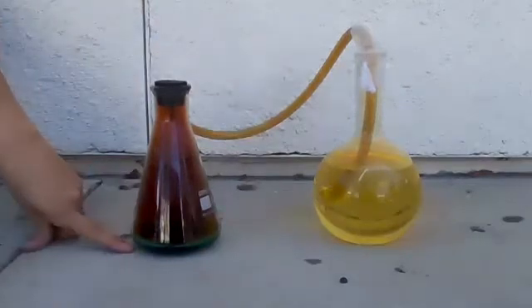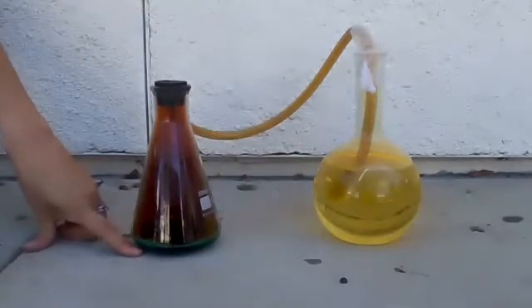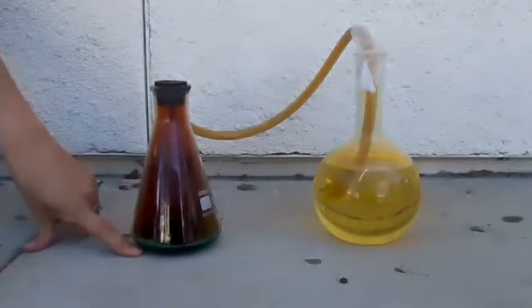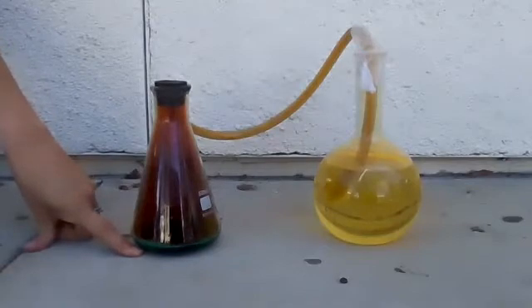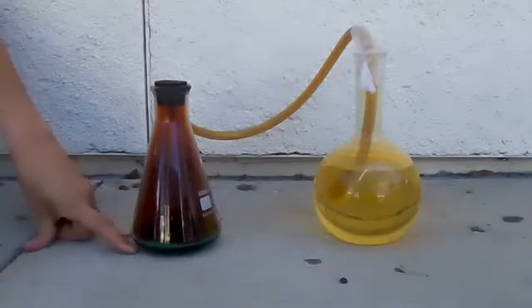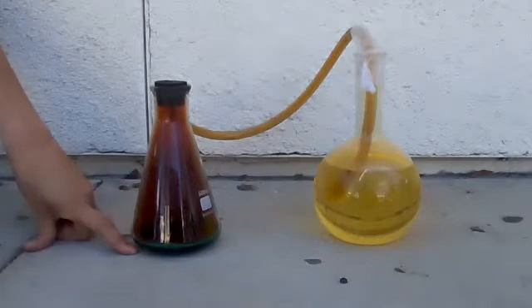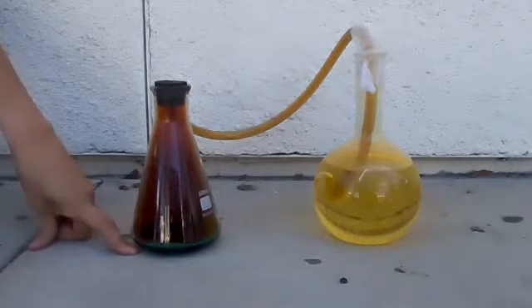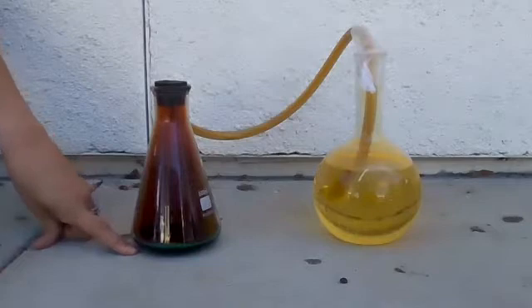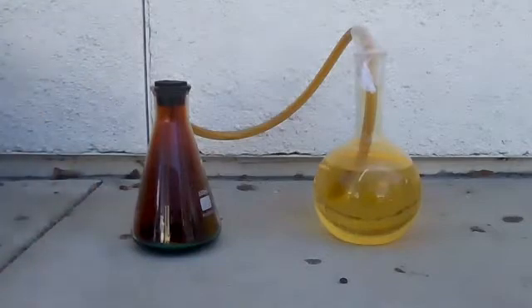The nitric acid is still dissolving the pennies — turning the copper metal Cu into Cu²⁺. That's what's making the pretty color, because copper nitrate is the ion form. So we're turning Cu with its full set of electrons into Cu²⁺.